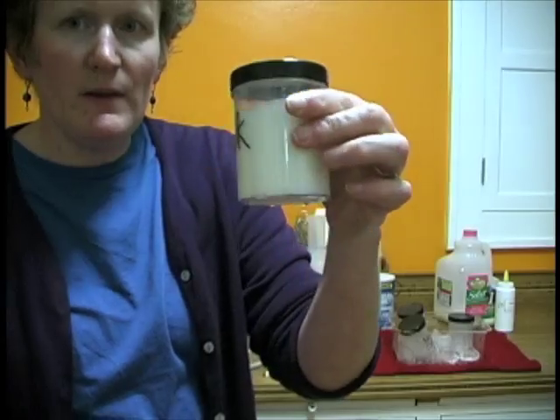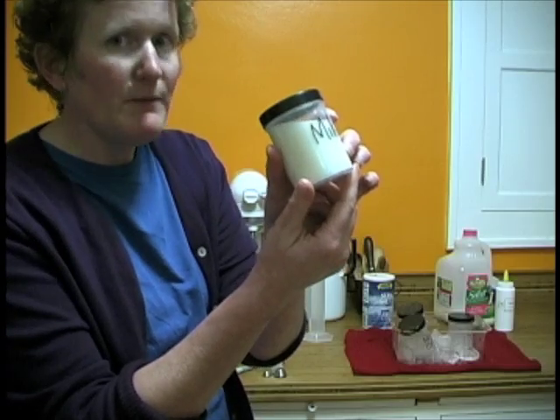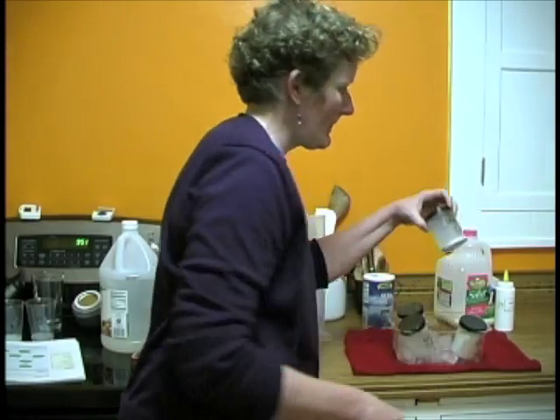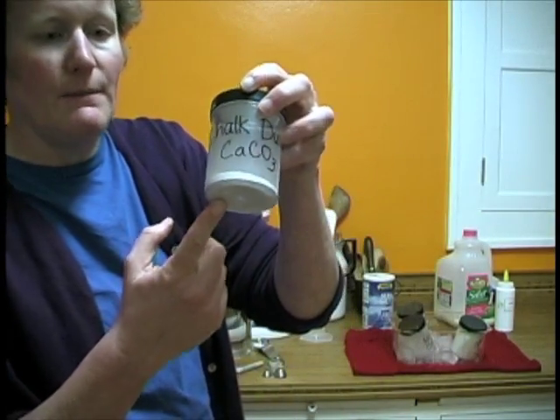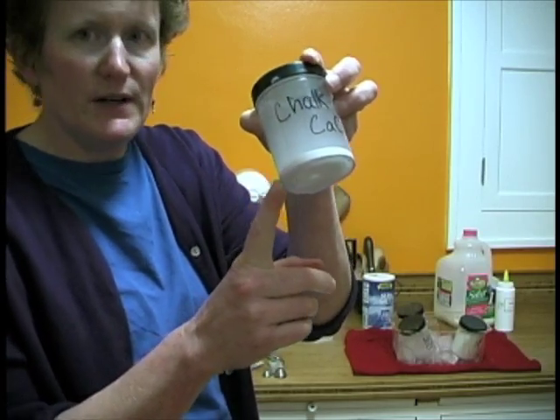When we cooled down the milk, nothing really happened. But does anything usually happen when you put your milk back in the refrigerator? The chalk stayed the same. Yes, it has solid on the bottom, but it had solid on the bottom when I put it in the ice.